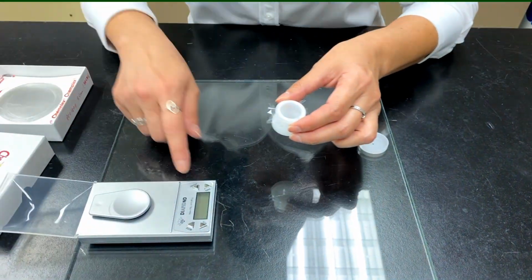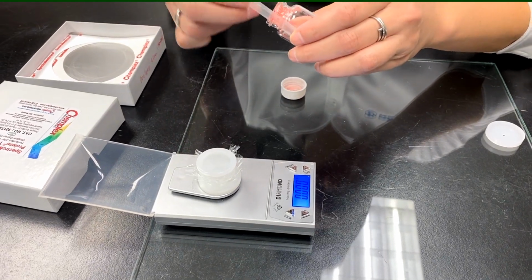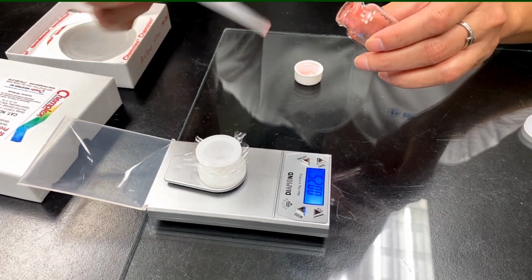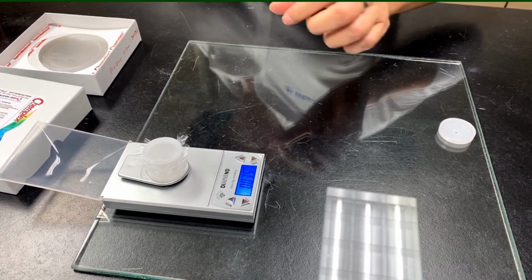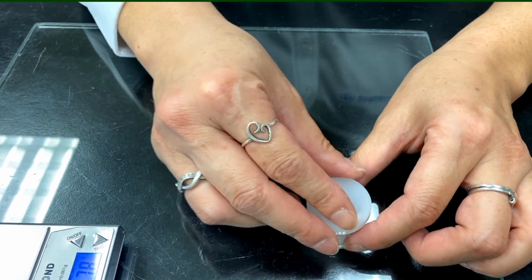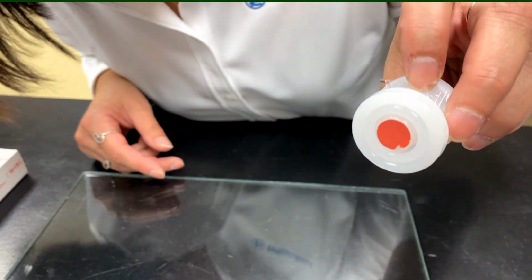So what I have here is a small balance. Then we're just going to tare this and put some powder in. You would only need about maybe 20 to 30 milligrams here, depending on whatever your calibration method is requiring. Exactly. So we have about 30 milligrams right there. The nice thing with the XRF is if we add more sample, we can get better detection limits, depending on the instrument that we're using. So you just want to tap this down so that it will cover the entire bottom of it, and then we're just going to put the cap on. I'm going to tilt it a little bit so you can see that the bottom of it is covered.